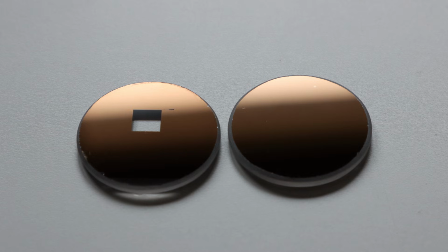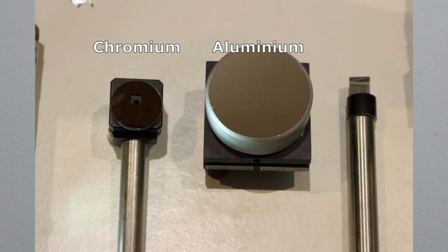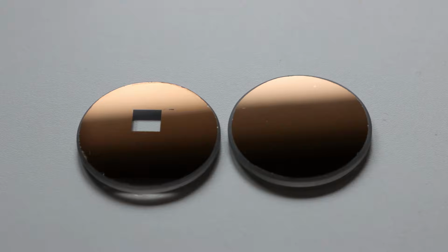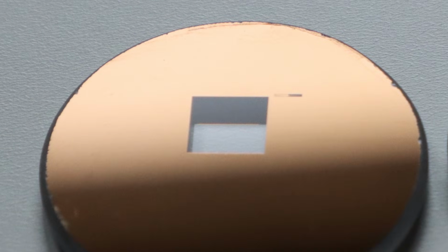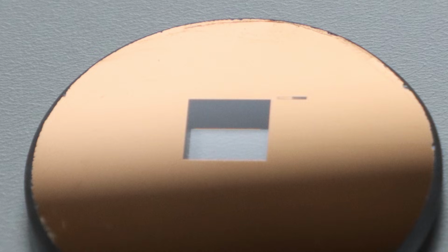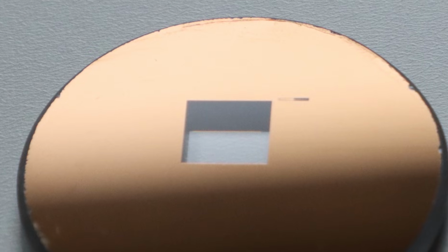As you can see, the chromium layer looks a bit dull, brownish, and it's certainly not a very efficient reflector like an aluminum surface. Now, why use these two interfaces for the test? Well, interferometry measurements work best if the two beams that we combine have comparable intensity. And so, because the sample with these nice test patterns was cut out of an old photolithography mask, I had to use a reference surface with a comparable reflectivity. And in both surfaces the chromium has about 25% reflectivity. An additional advantage of using a low reflectivity reference surface is that the sample also contains an air glass interface, which has even lower reflectivity, say around 4%. And for this reason, using a low reflectivity reference is also an advantage.